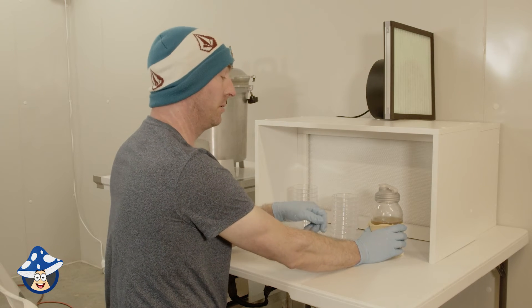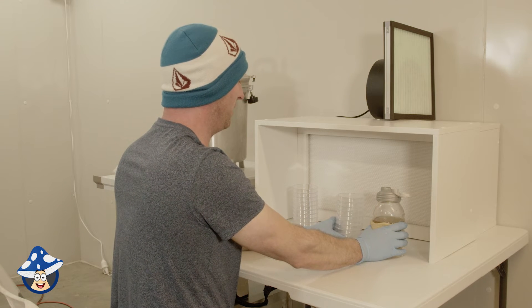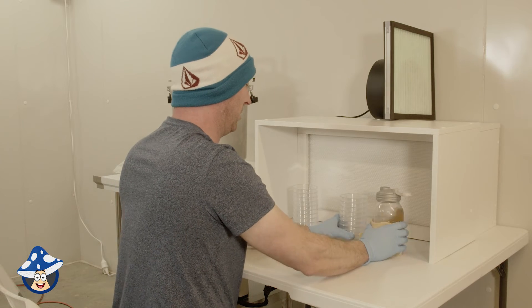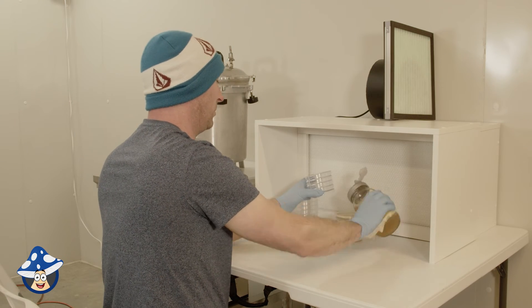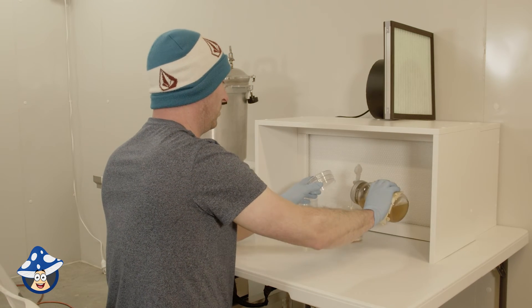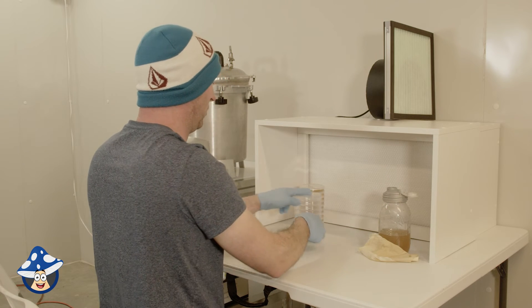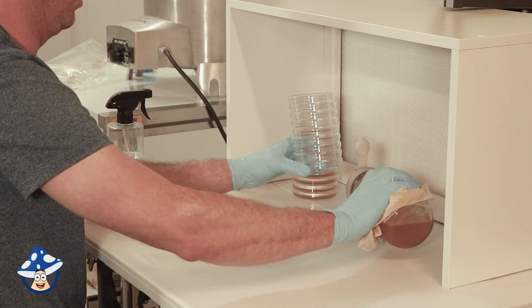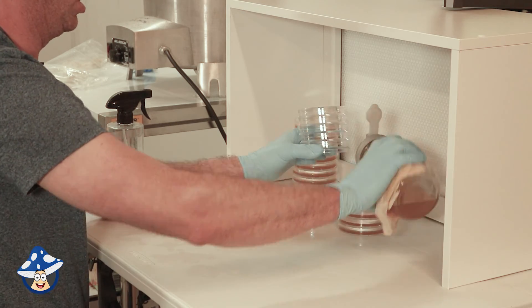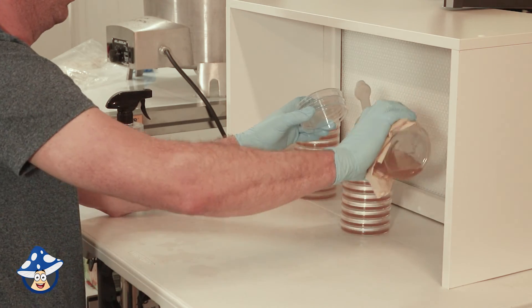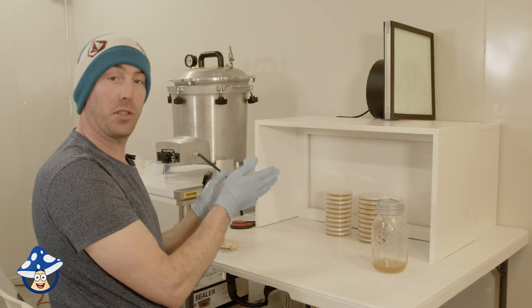We'll keep giving it a mix up every so often and when it's cool enough then I'll start pouring. So when it's cool enough to pour, always working from the side. It's cool. Let's go. [Pouring] We could have a little bit left over, that's fine. We'll just leave those to cool and set solid.